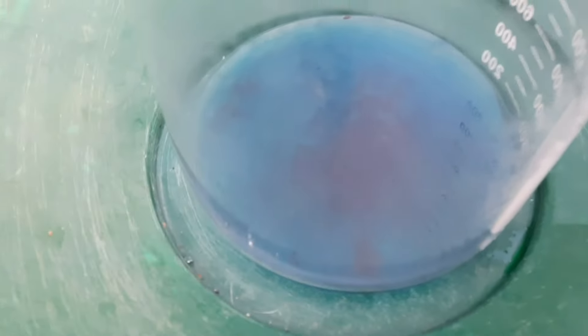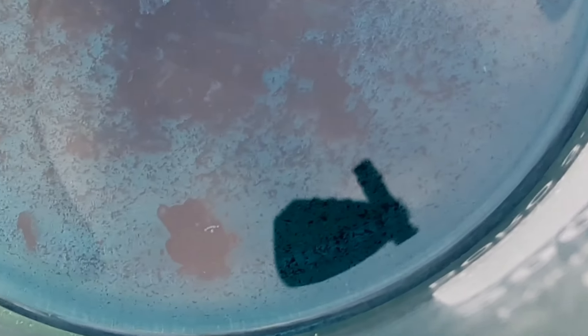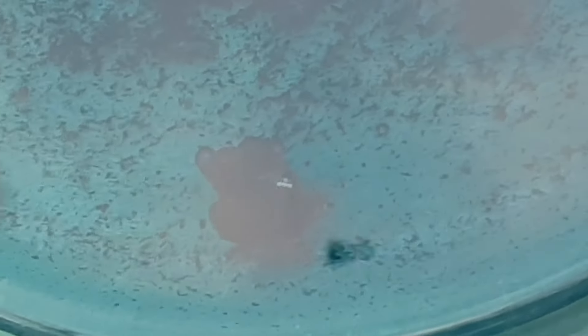It's the next day — we lost power up here because of a bad storm, so I wasn't able to put this on the heat. What I did was leave the water and nitric sitting overnight. I put it in the shed to keep it away from any wind. We've got one little piece that's still bubbling just a tiny tiny bit — I'm going to zoom in on it — he's the last of it bubbling right there. I'm going to leave it until there's no more bubbling, then put it in the silver cell and melt it down. I've got some errands to run so I'll just let it sit and do its thing.